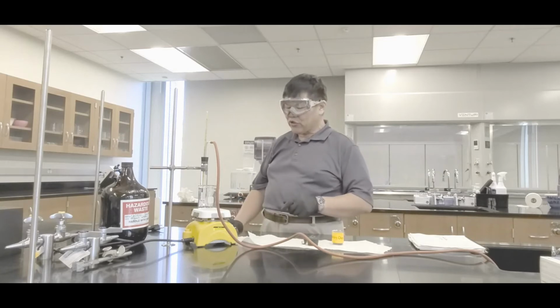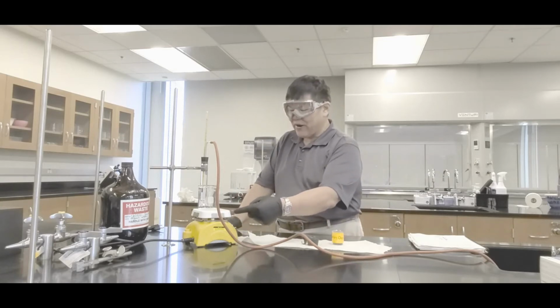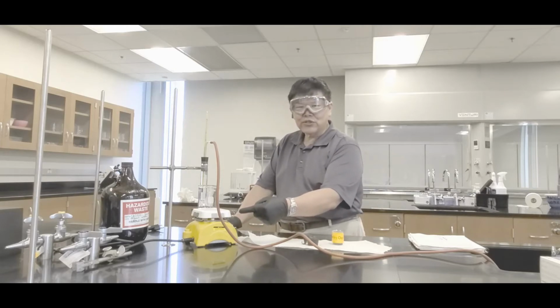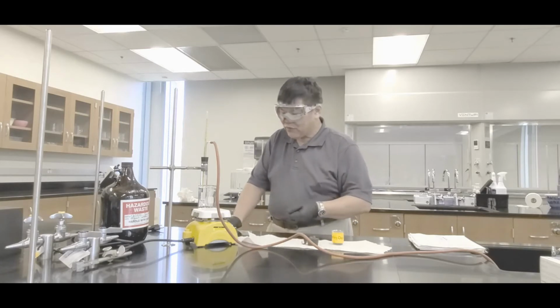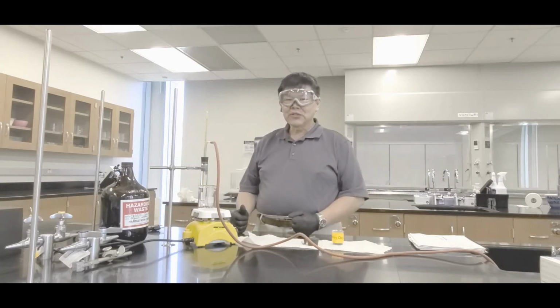And then the third safety precaution is this. See that white top right there? That can be potentially very hot. Never ever touch that, because you can get a second or third degree burn touching that. And of course, you have a glove, that would suck when you have a melted glove on your hand, yeah? So therefore, unplug, don't turn anything on, let's prep, yeah?